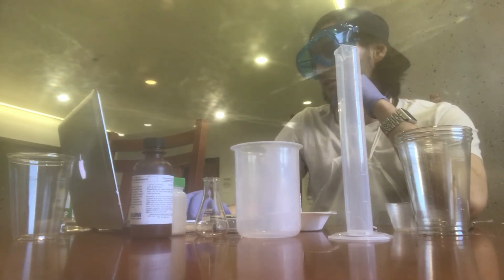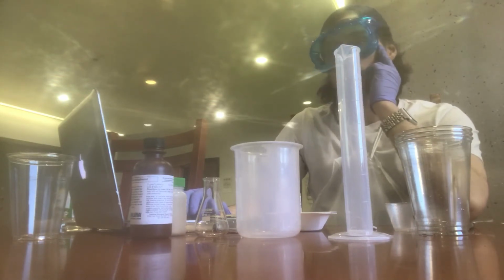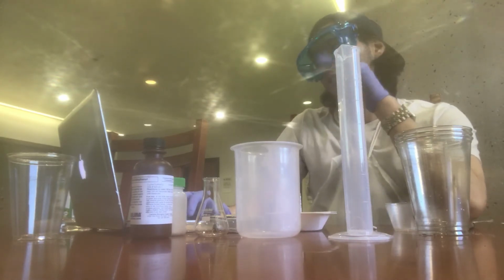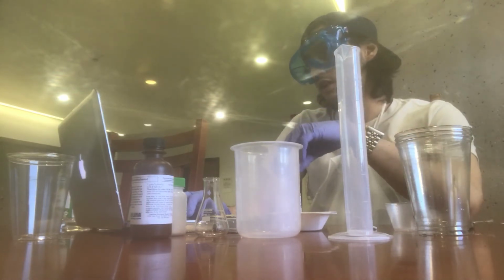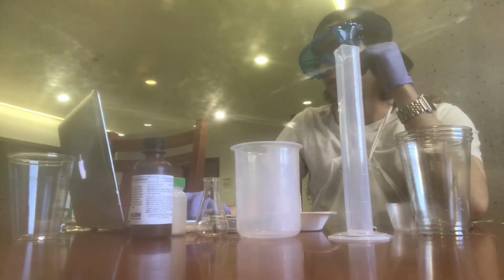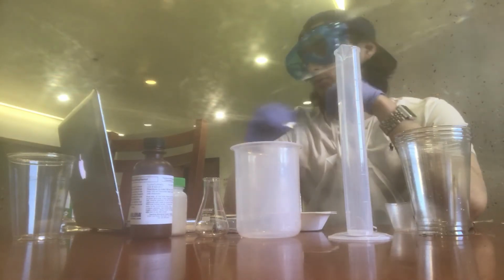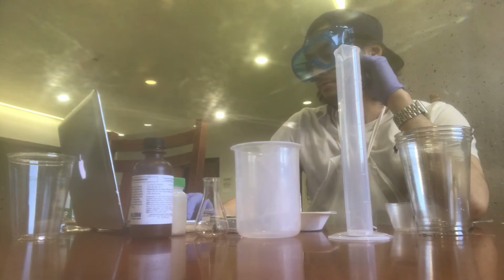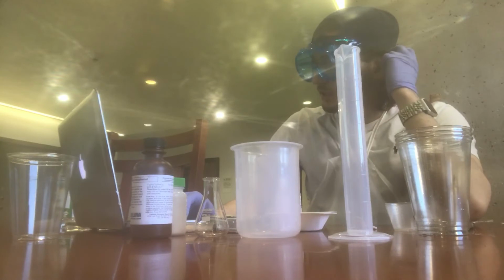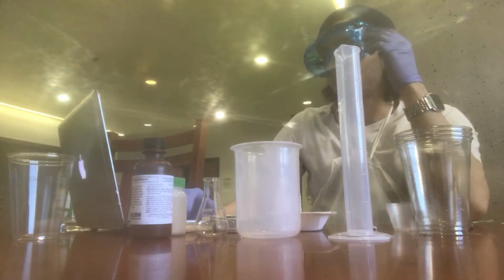So let's look at the oxidation and reduction titration. One type of titration is a reduction oxidation titration, and in this titration, electrons are transferred from the reducing agent to the oxidizing agent. Oxidation, which we learned in previous labs, refers to the loss of electrons. Although it says reduction, you are actually gaining electrons, which can be kind of confusing. In this experiment, like I said before, a standard curve is prepared using solutions, and we're going to compare it to the unknown sample and see how it goes.